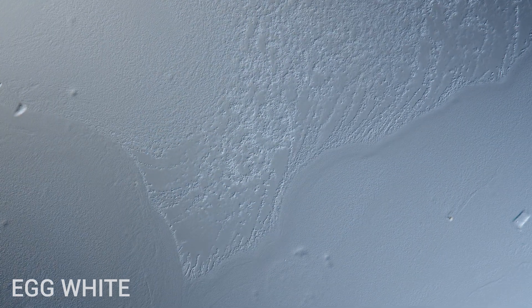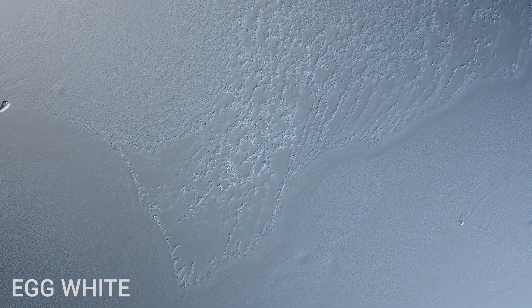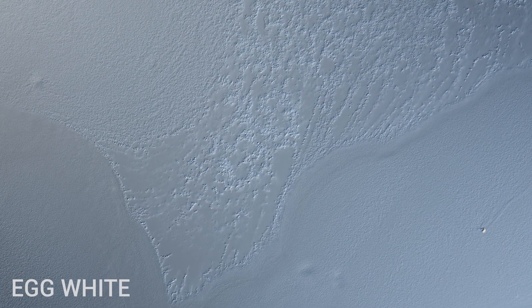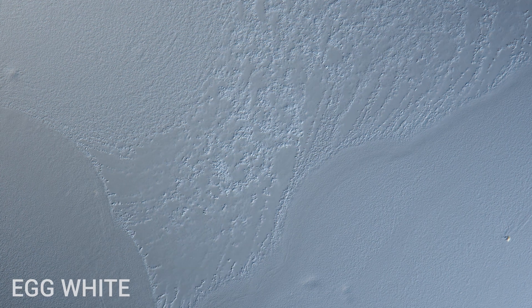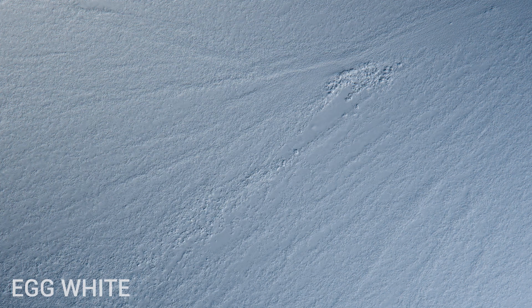When fresh and in its native state, albumen has a clear liquid appearance, similar to water. For this project, I've applied a small amount of heat to set the egg whites and make them visible.